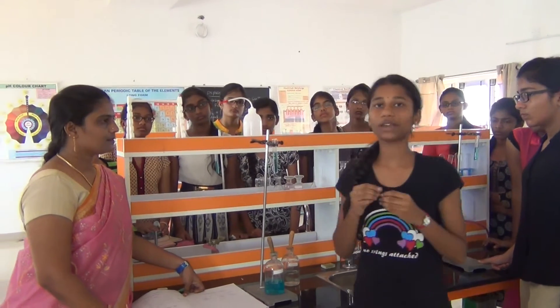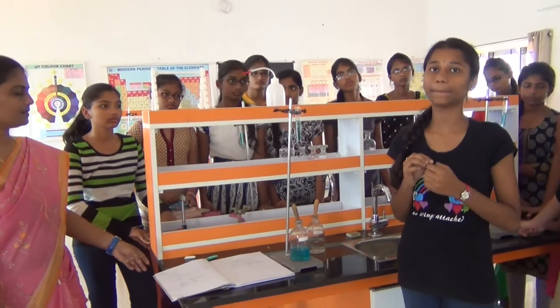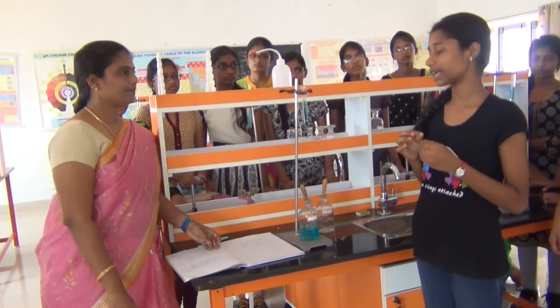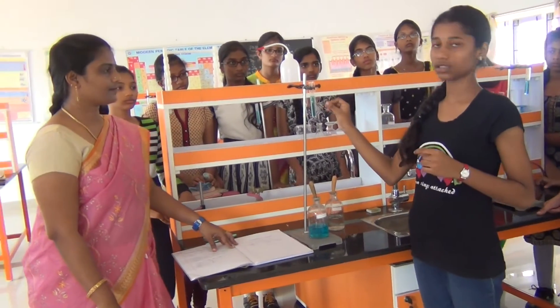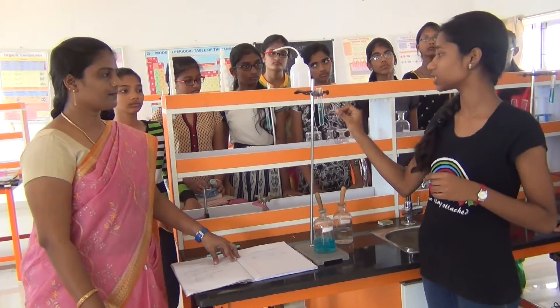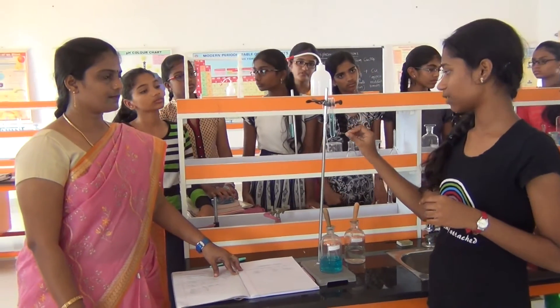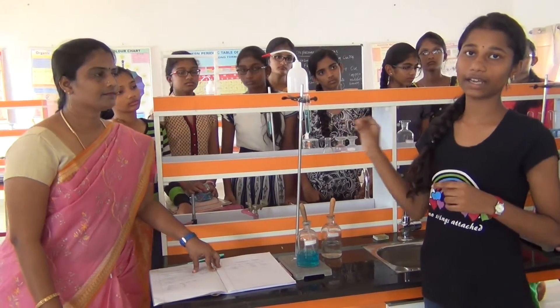We should wait for half an hour for the complete reaction to happen. Then we can see clearly that this blue colour solution turns into green colour solution and reddish brown deposition forms on the iron layer.